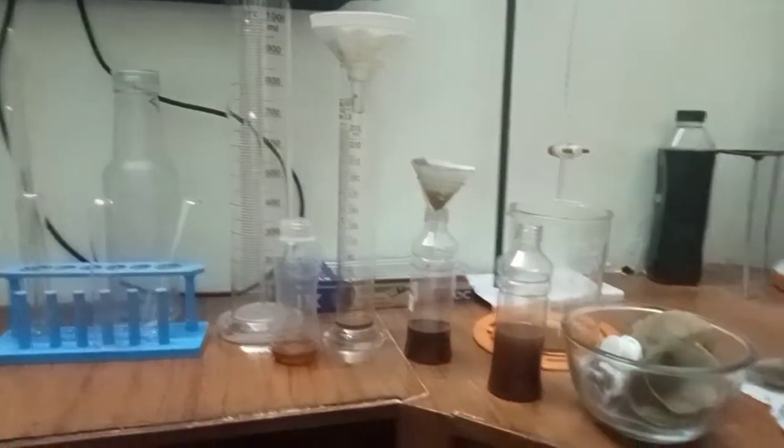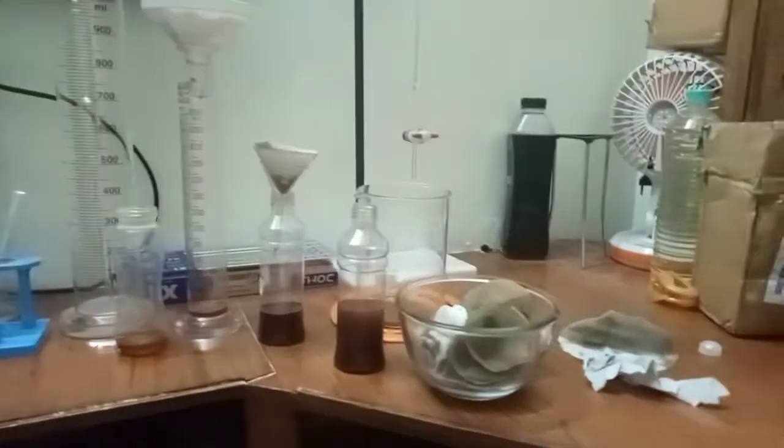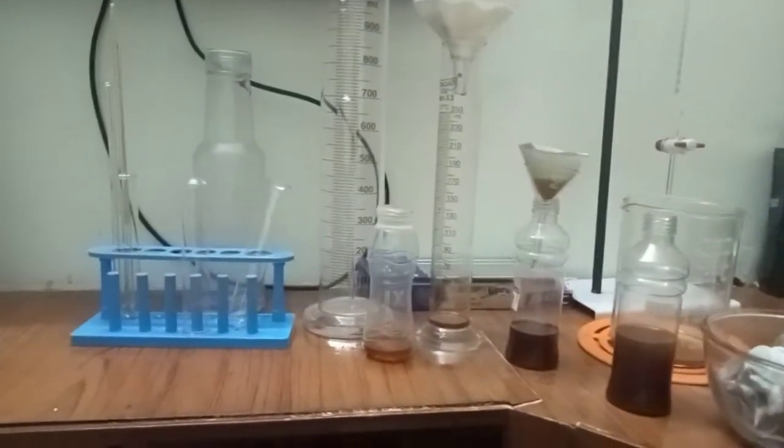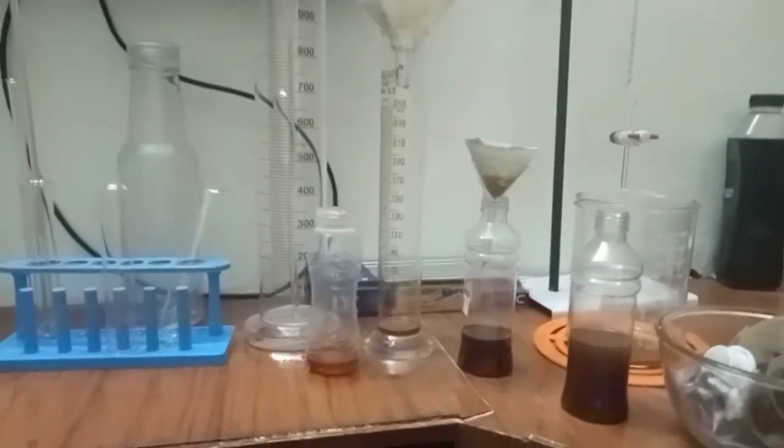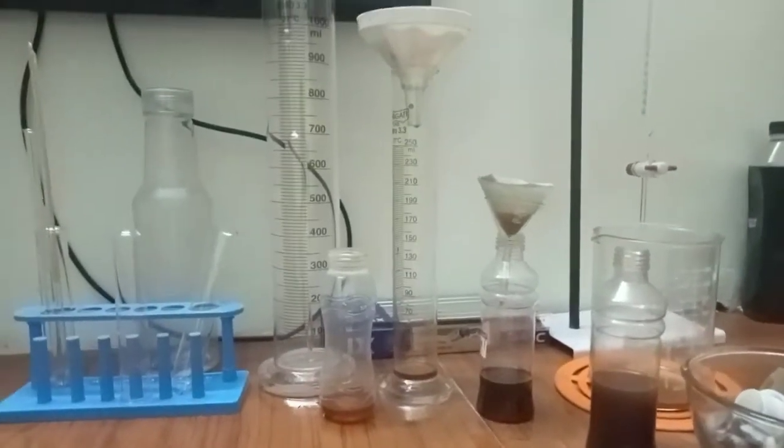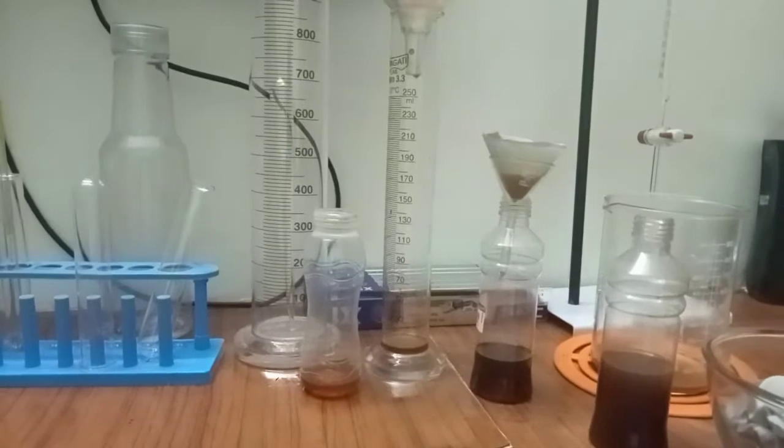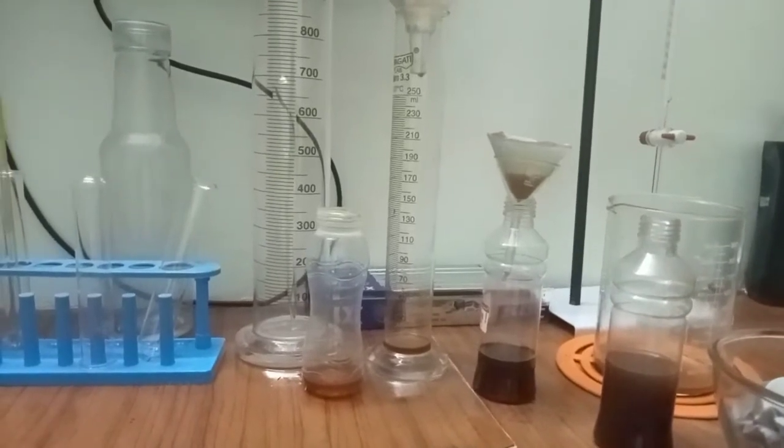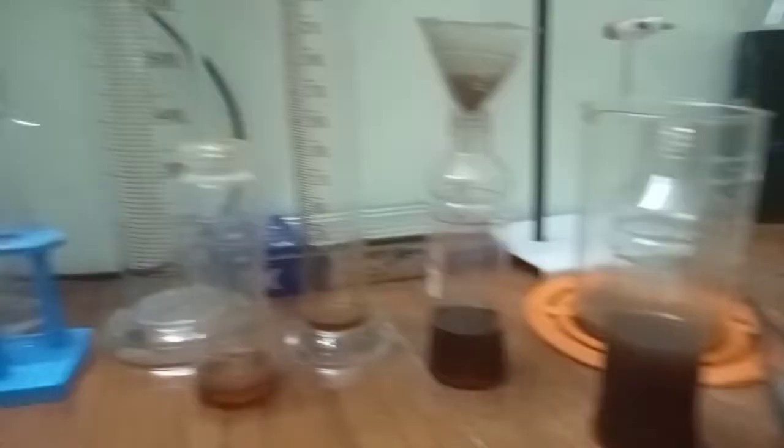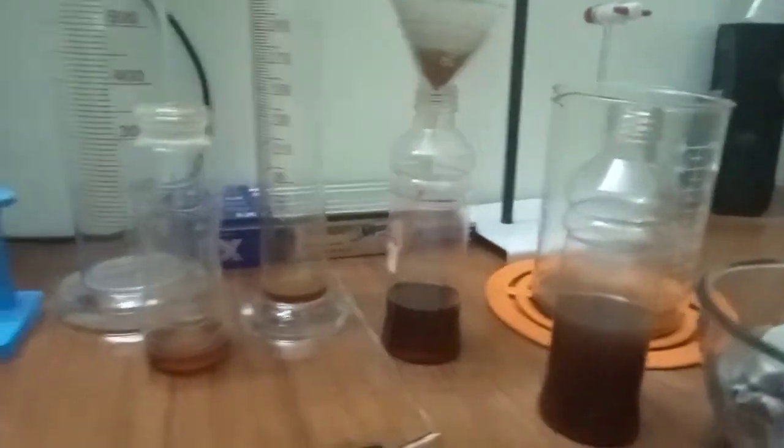Hi viewers, good evening. Today my lab has become a little messy for conducting a new experiment. Today I have gone for different stages in the chemical bleaching of waste vegetable oil.